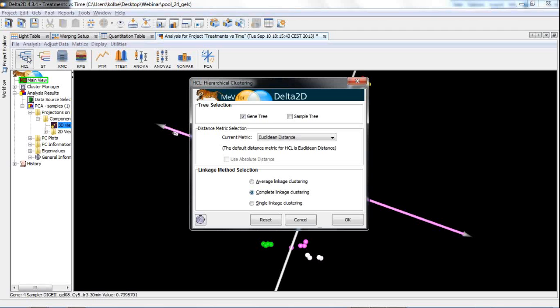Now let's have a look at hierarchical clustering. I would like to cluster not the genes but the samples, and we recommend that you do this just at the beginning for quality control. Later on, for any test, it is nice to cluster for the genes and for the proteins, but not for the samples, because then you change the order of the rows, of the columns, sorry. And if you change the order of the columns, then it will be difficult to interpret expression profiles. You should keep them in the order as they come from Delta2D to the other views, from the quantitation table, for example. In this order, you know the expression profiles, and if you always cluster the images again, then you will always get a different order of columns, and this doesn't make sense.